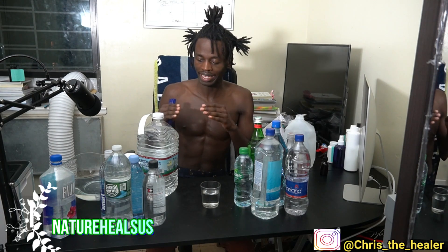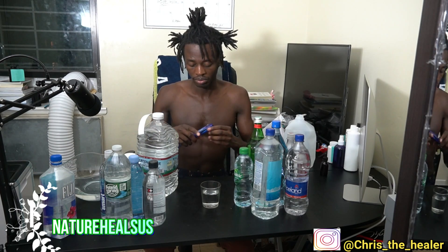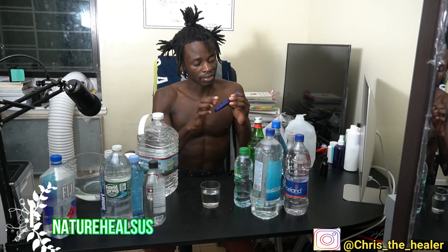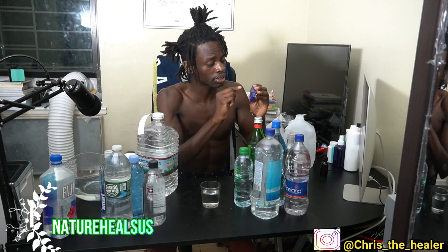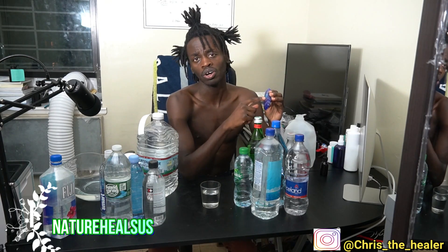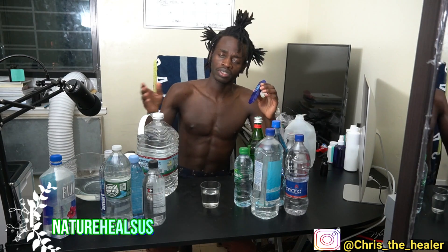It's making our body work a little bit more when it comes to detoxification, because our body has to detox whatever is inside this water out of our system. Since I have a reading of 190, if I look at the back, Crystal Geyser falls between hard water — it's between 100 to 200, which is hard water. So this water is not good. Spring water, guys, is not good.